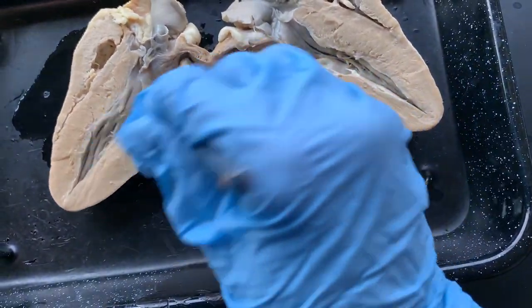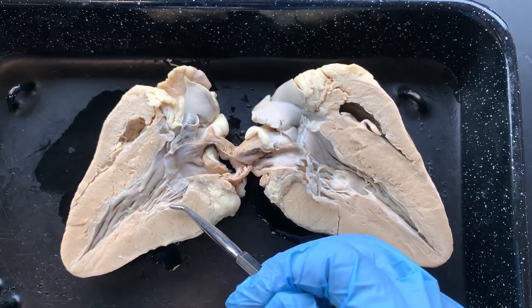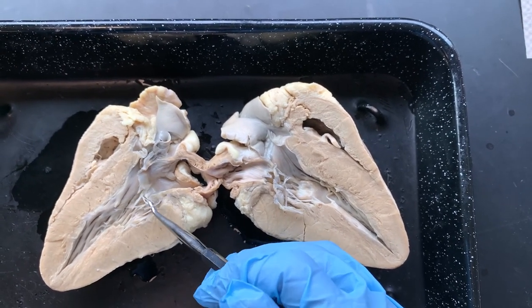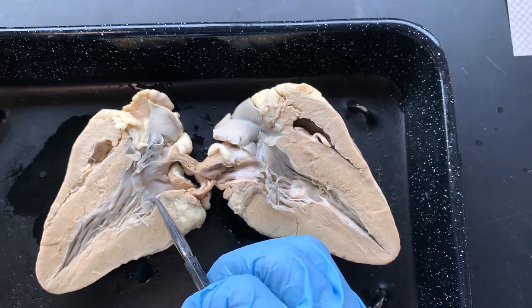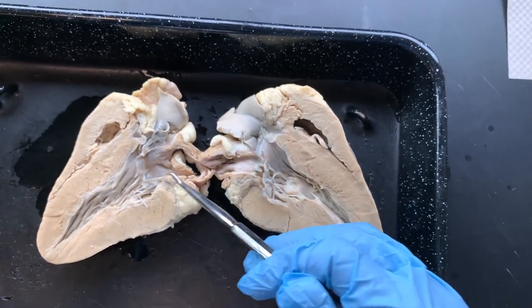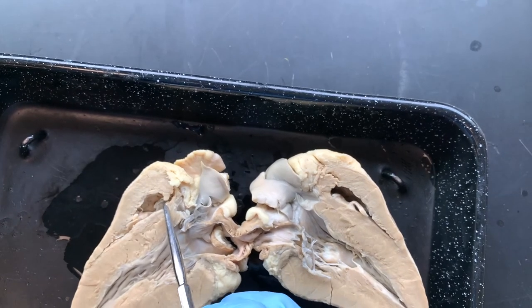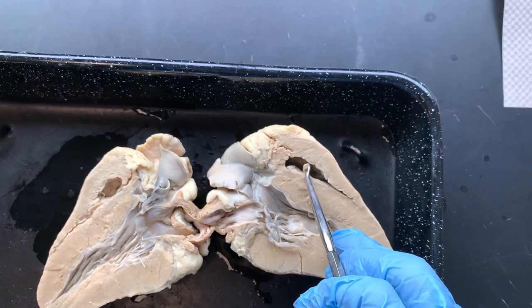You can see the chordae tendineae here. On the left side, the bigger side has the bicuspid valve — if you see a valve on the big side, it's the bicuspid. B for big for bicuspid for big side. Bicuspid means the number of cusps that you can see, but we think big ventricle, bicuspid. The tricuspid valve is tiny and it's been torn on this one. And I can see the moderator band here.